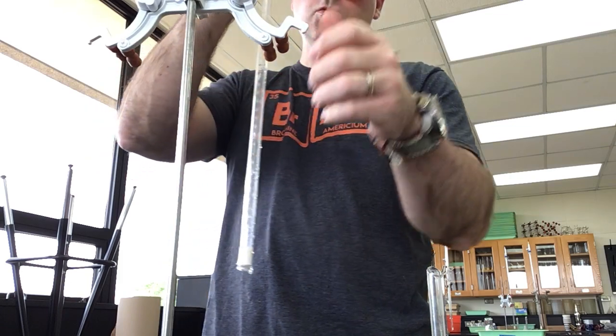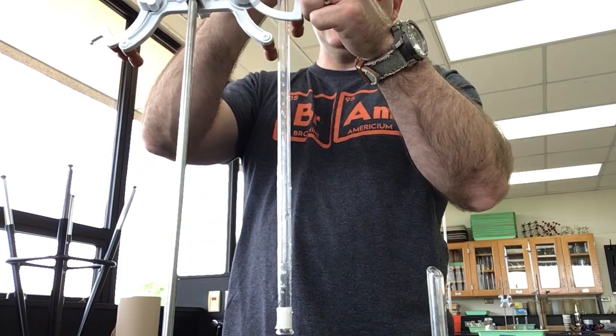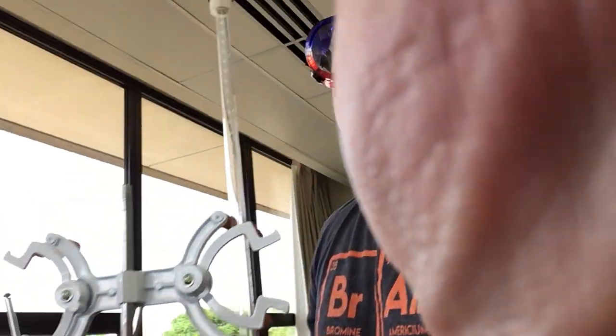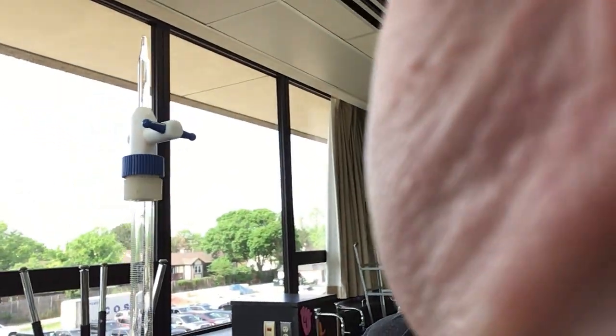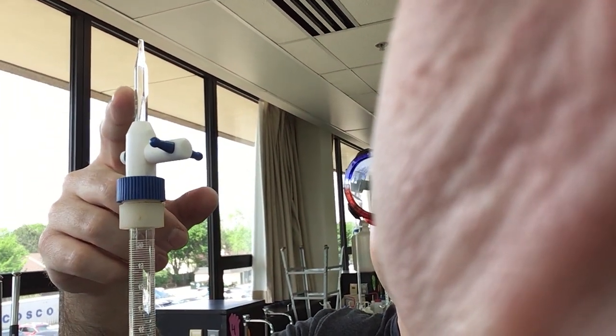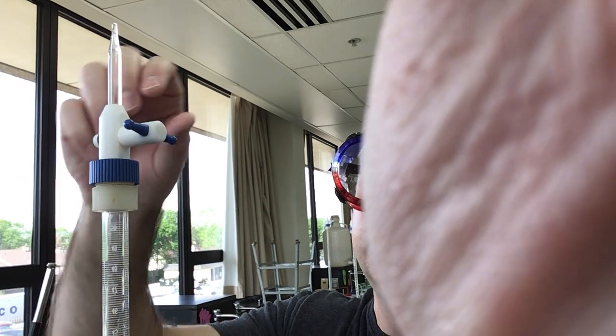So we want to store it with the tip up to the sky. The other thing that we need to do—right now my valve is closed—watch what happens when I open it up because there's actually water in here.